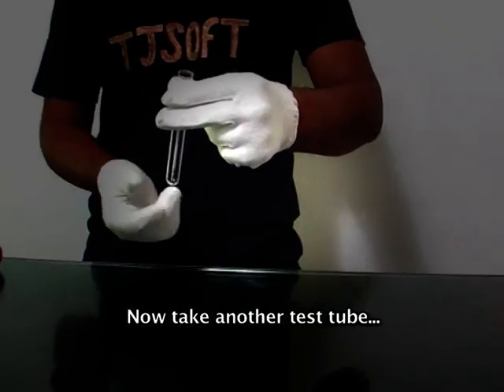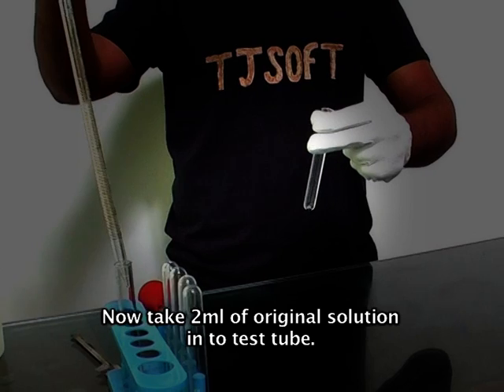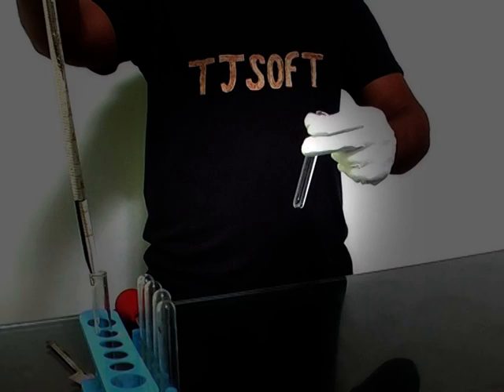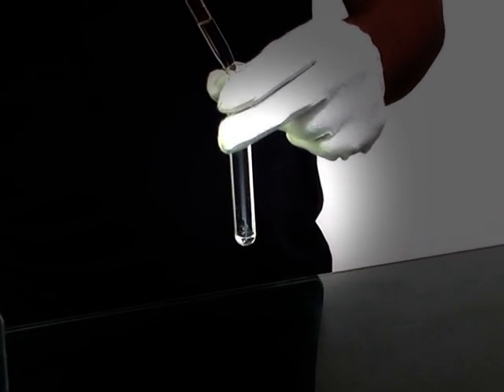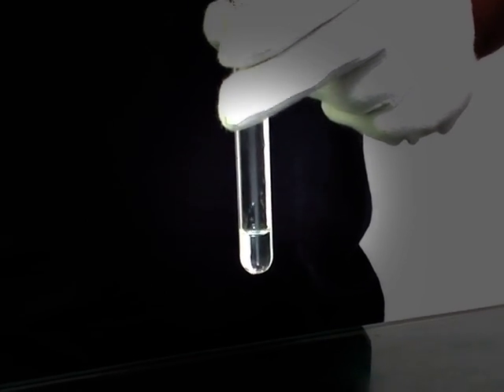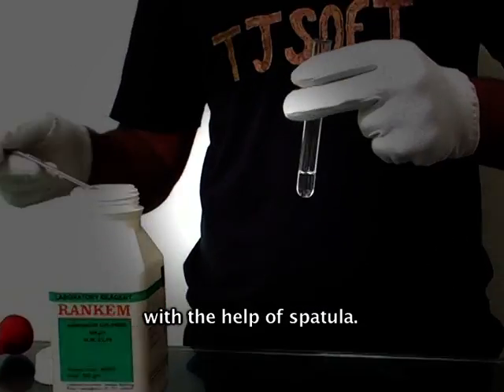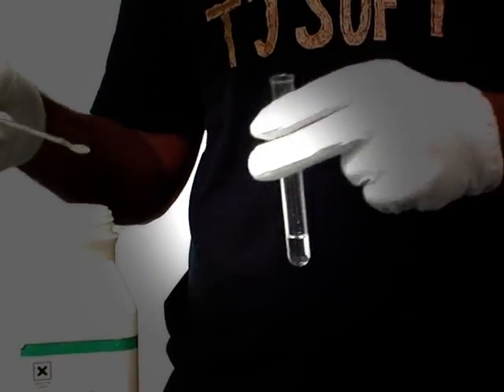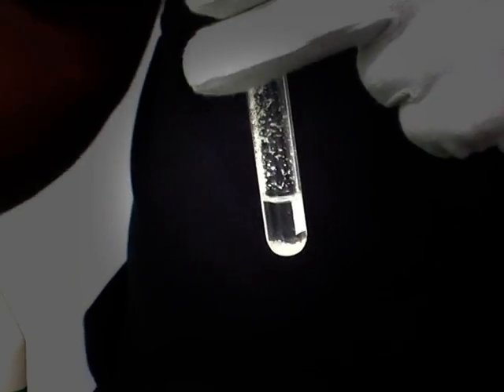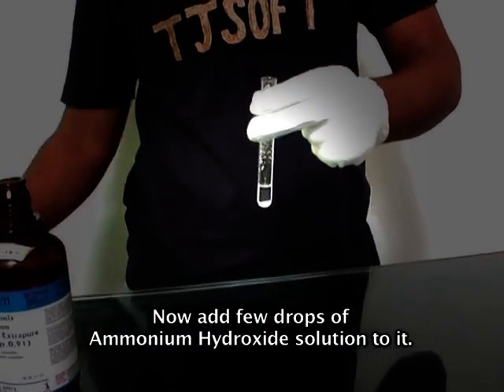Now take another test tube and add 2 ml of the original solution into it. Now add a little amount of solid ammonium chloride with the help of a spatula. Now add a few drops of ammonium hydroxide solution to it.